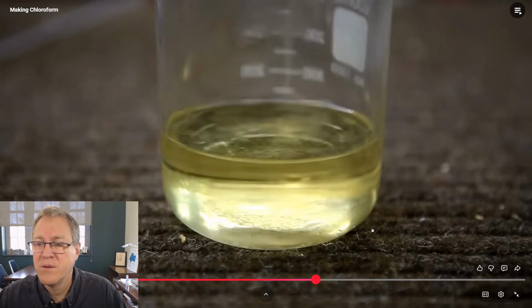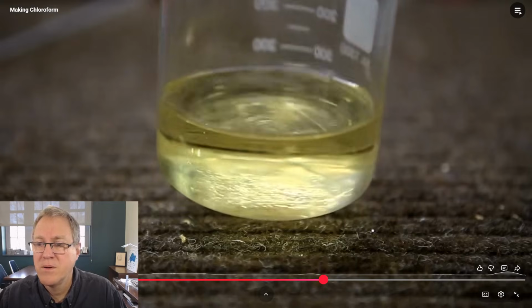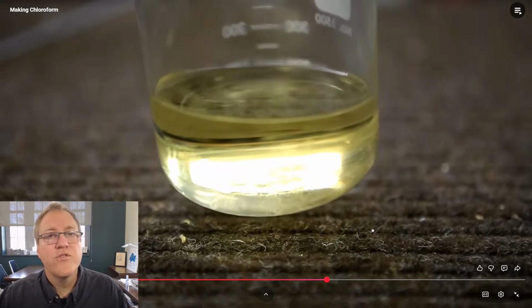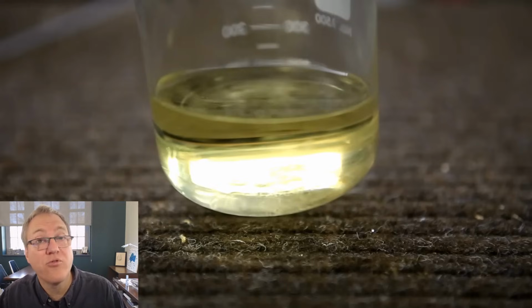So everything we talked about is there, and we walked through the mechanism of the process. Form sodium hydroxide and sodium acetate. After allowing the solution to sit undisturbed for a short period of time, it's possible to see chloroform in a separate layer on the bottom. So that is a key idea. Chloroform is not very soluble in water, and it is more dense than water, with a density of close to 1.5 grams per milliliter.